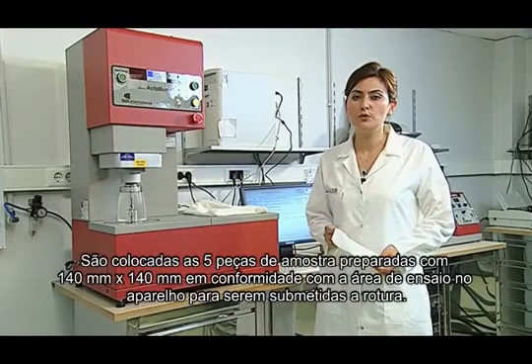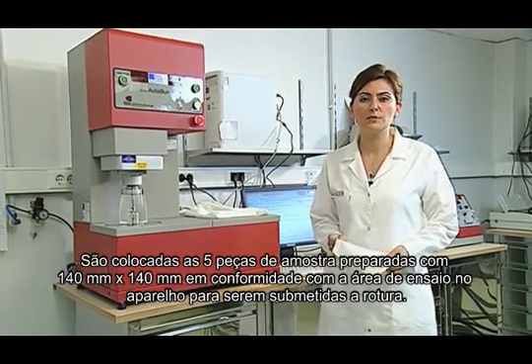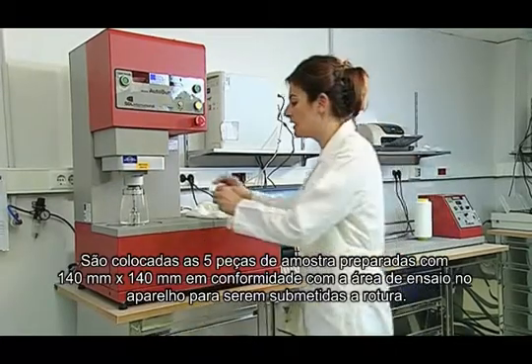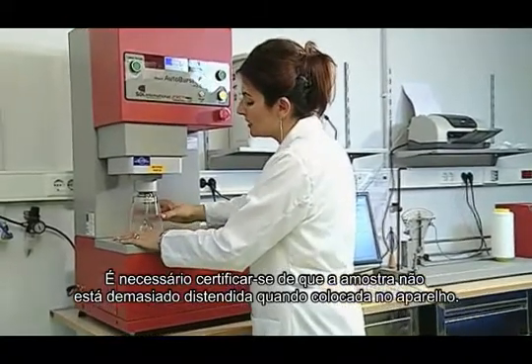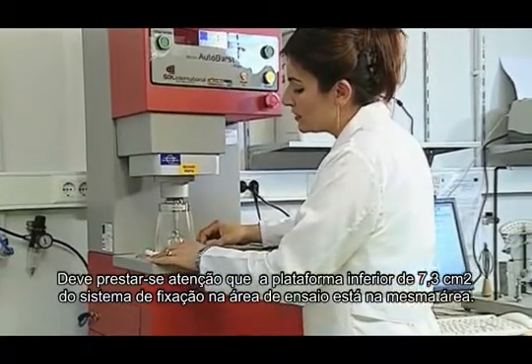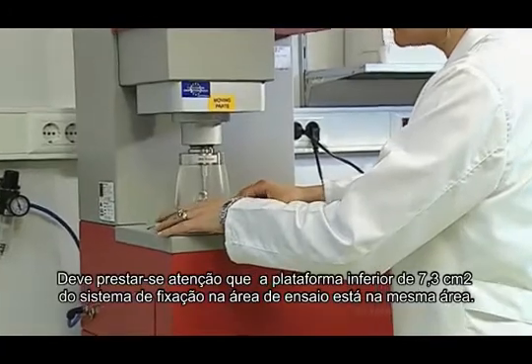We put 5 pieces of specimen, which we have prepared as 140 mm by 140 mm in accordance with the experiment area, into the device to burst them. We must make sure that the sample is not tight when placing it in the device. We pay attention to the fact that the bottom tray of the 7.3 square centimeters clutching device in the testing area is in the same area.